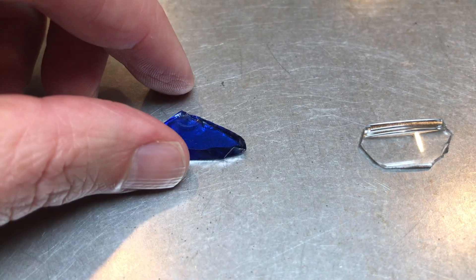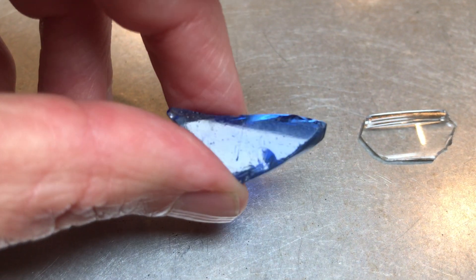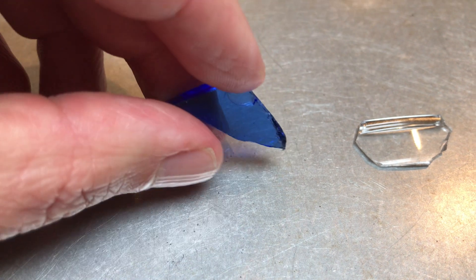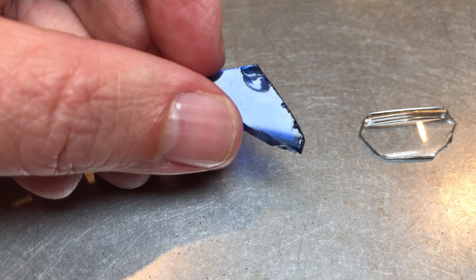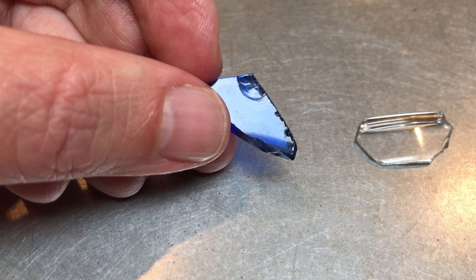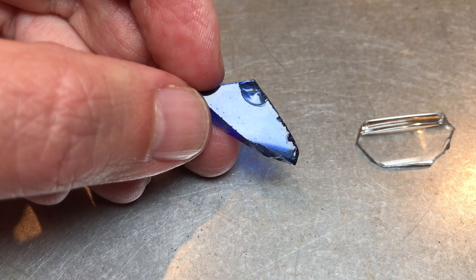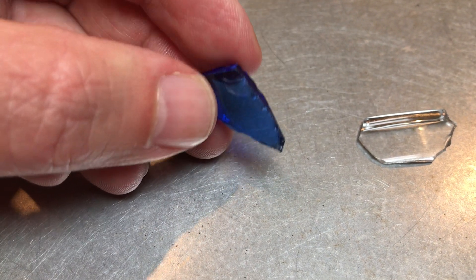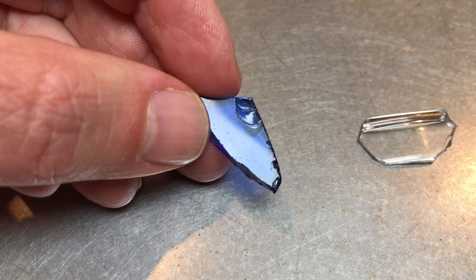So let's look at fragment one. I don't really see anything that's textured or anything that looks like it was intentionally placed there. What I do see however is a lot of fine details. Fine details are things that essentially came about accidentally during manufacture or after manufacture during wear and tear on the items. You can see a lot of fine little scratches.